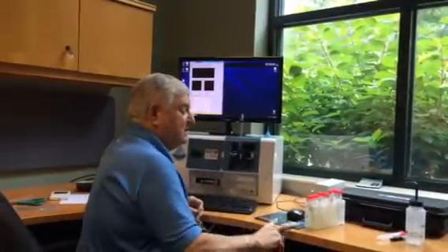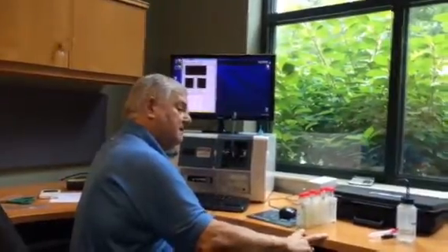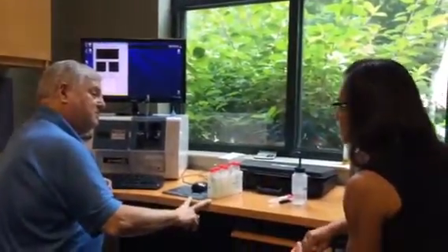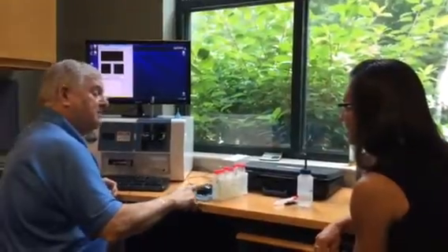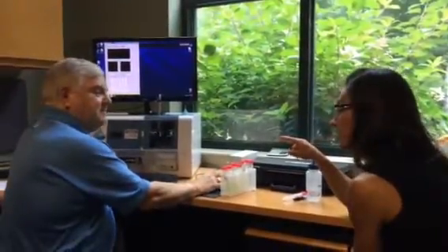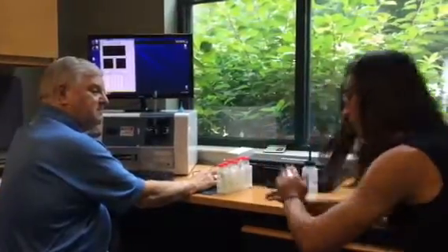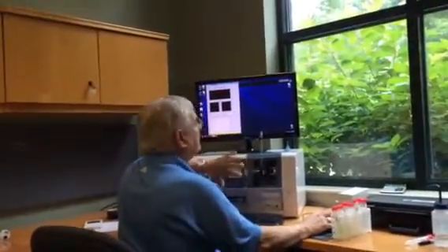So what you're telling me is that step of getting the pump to run as an early step is in setup focus, not in auto image. Correct. See, that's where I would not have seen that. I would have been distracted because I would have been looking for it in auto image. Yes, and you can set up an auto prime with the instrument, but it's easier to just do it by hand. Right, exactly. So at this point, before I even put that in, I'll go to auto image and set that up.